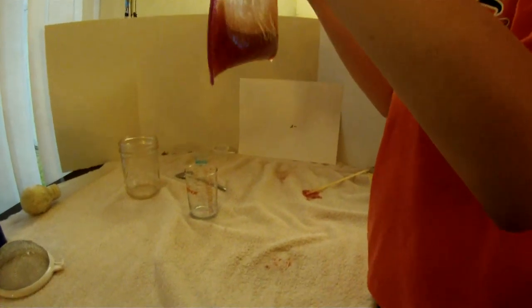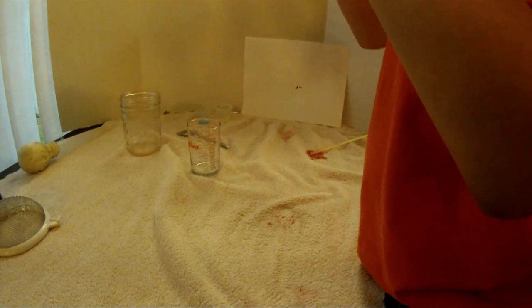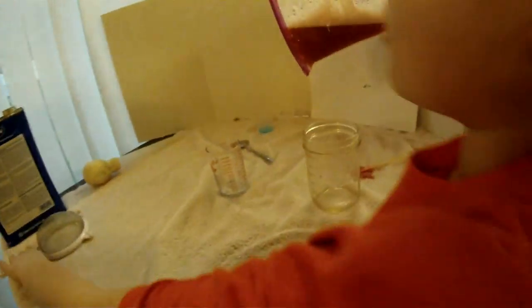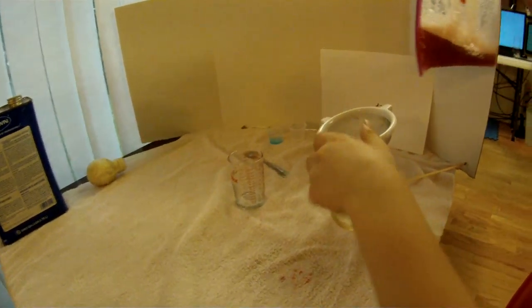You've got to try to mash it up carefully so you don't make foam. Whoops - I've seen we made a mistake.